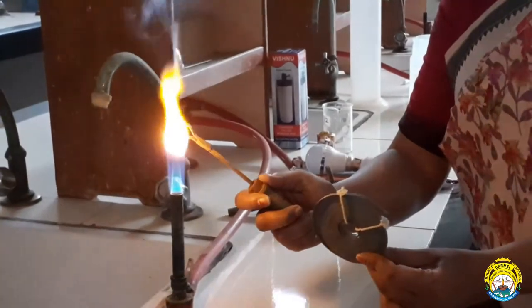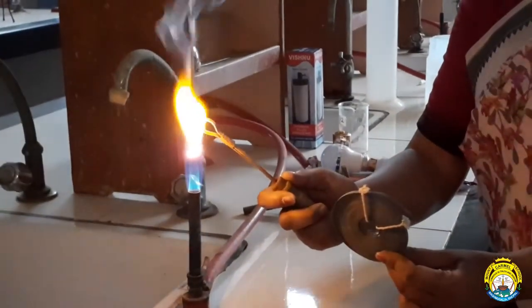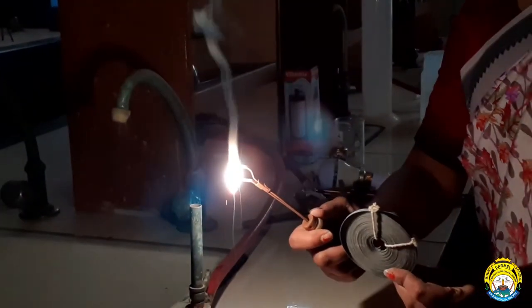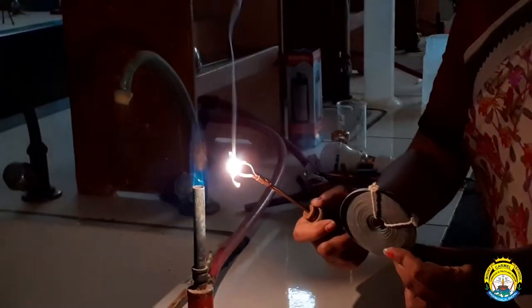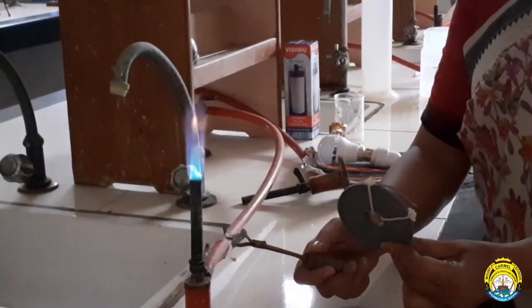Can you see? Magnesium metal strip is getting burned with a dazzling white light. Isn't it beautiful? Can you tell me what has just happened here?